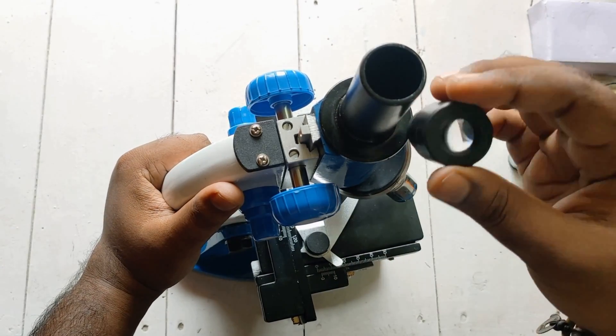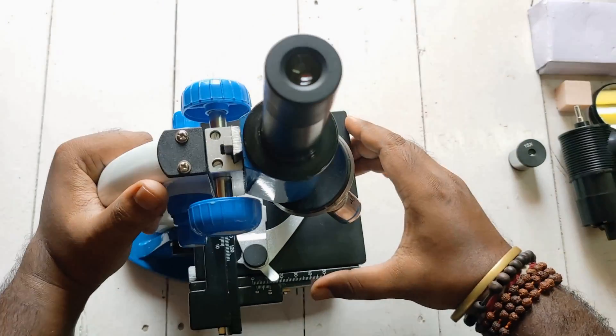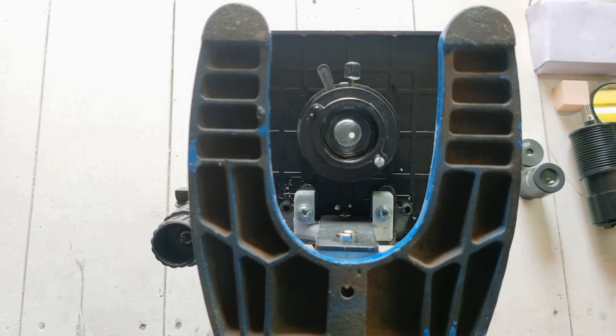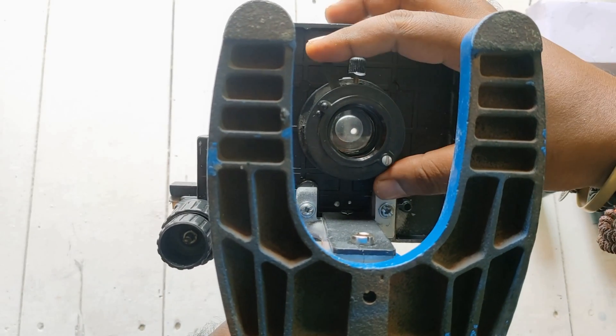And here are the eyepieces. Another thing I want to show you - below here is the aperture setting. You can easily adjust the aperture here, see.